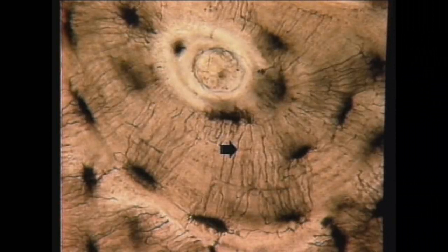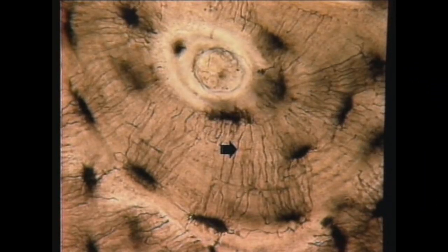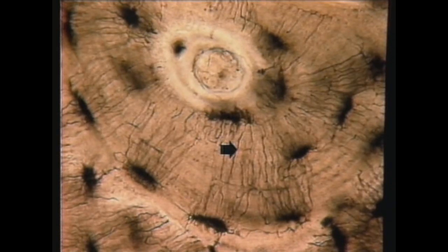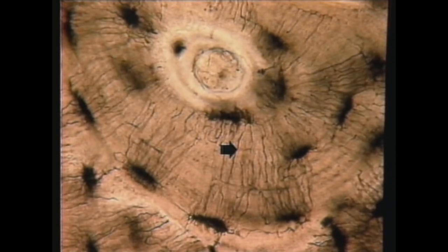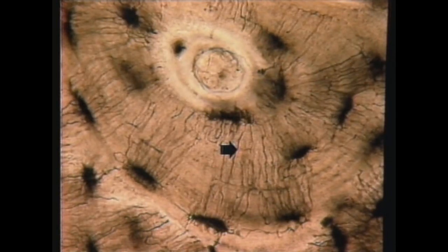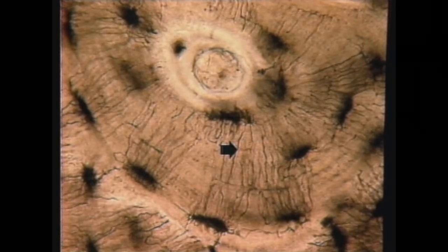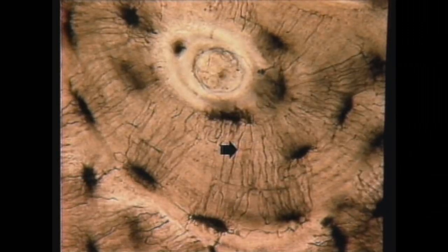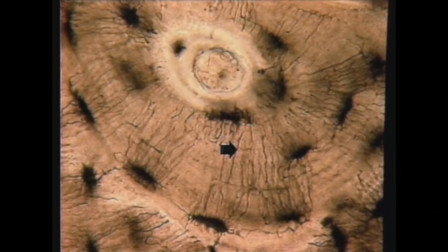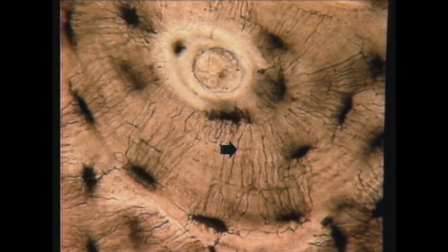Question number four. What is the thin dark line the arrow is pointing to here? The answer is a canaliculus. That thin dark line is a canaliculus, which is a channel through the bone through which the osteocyte process passes.